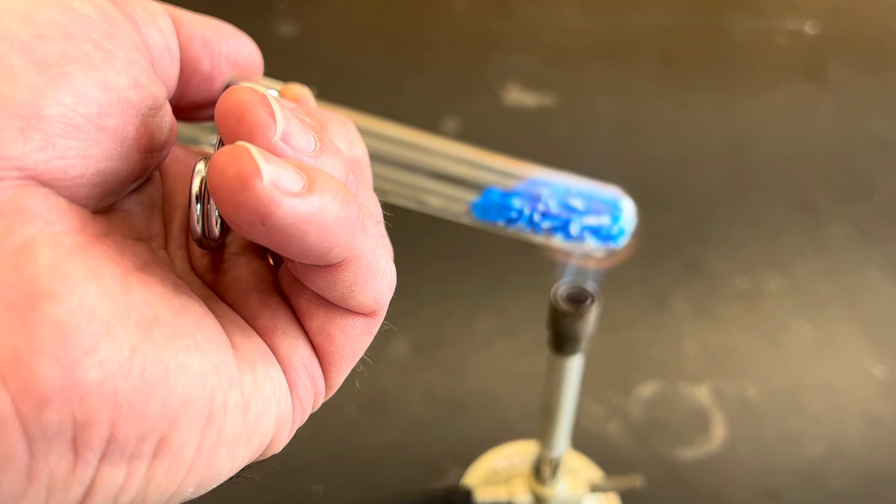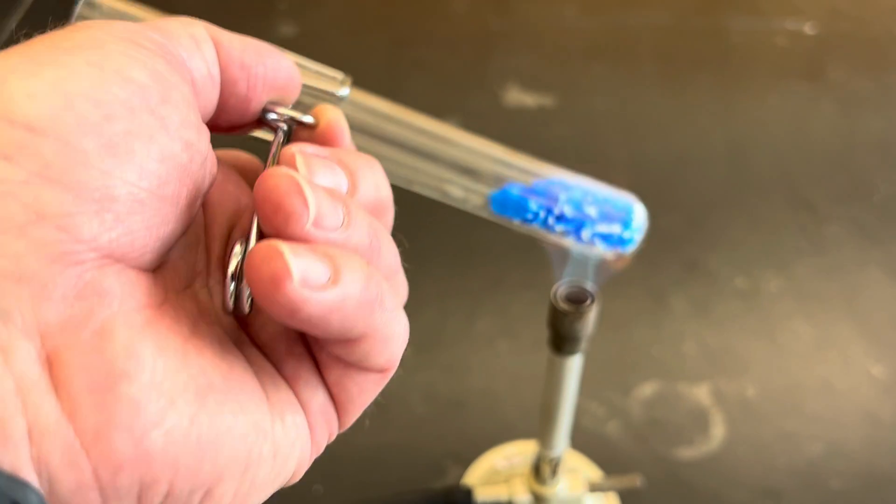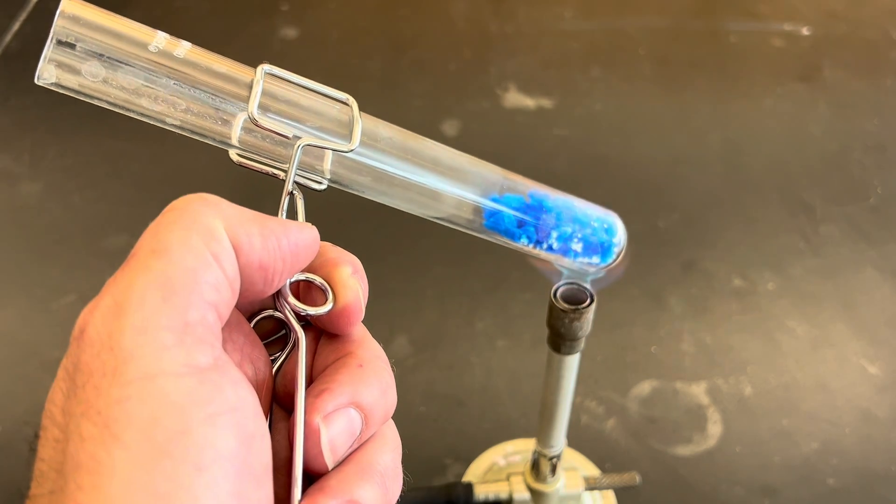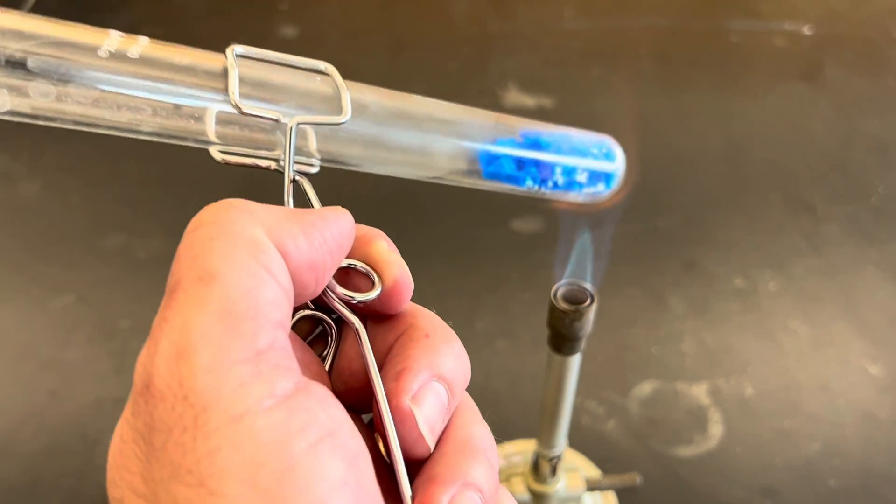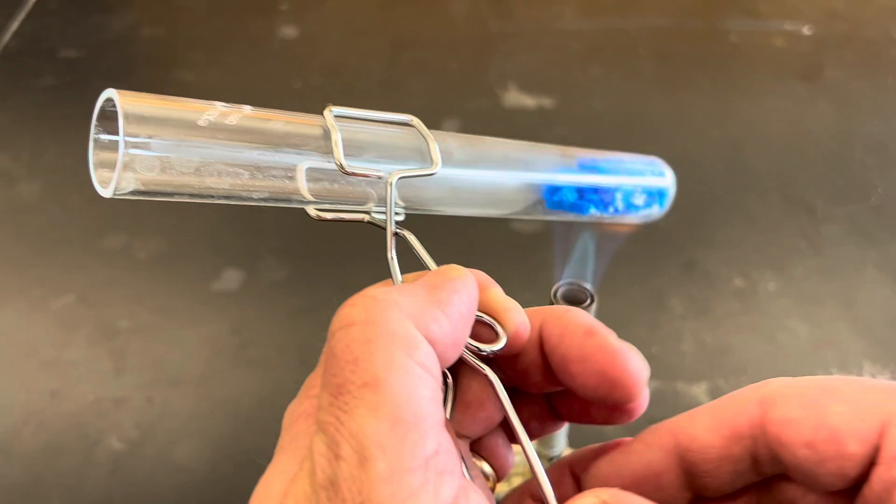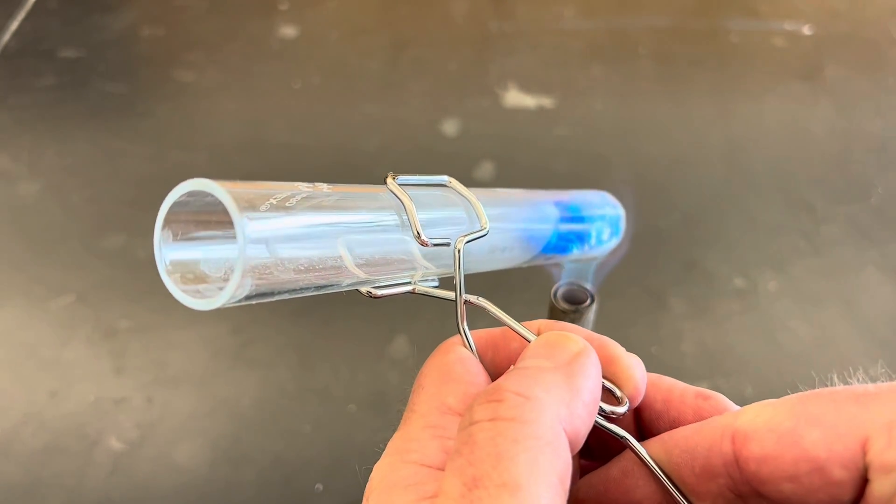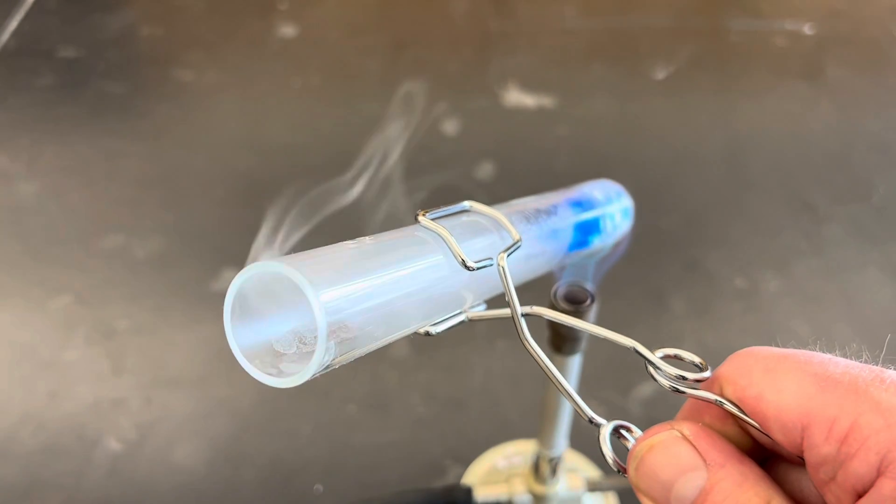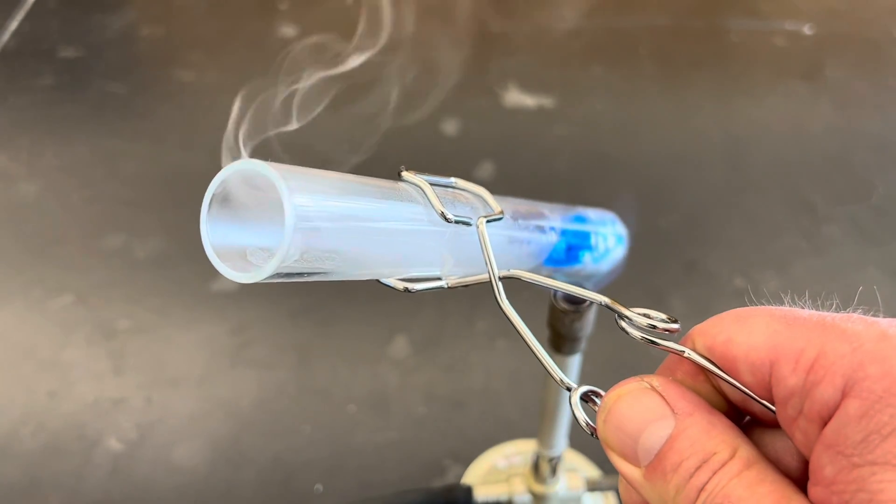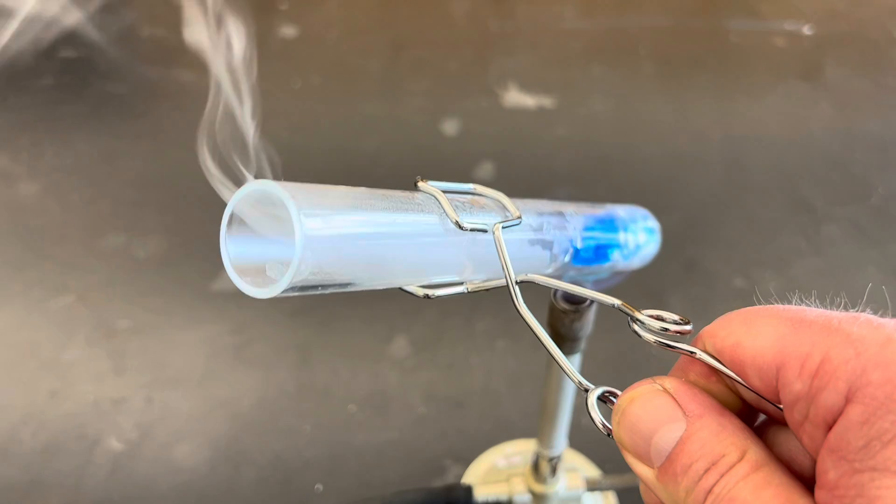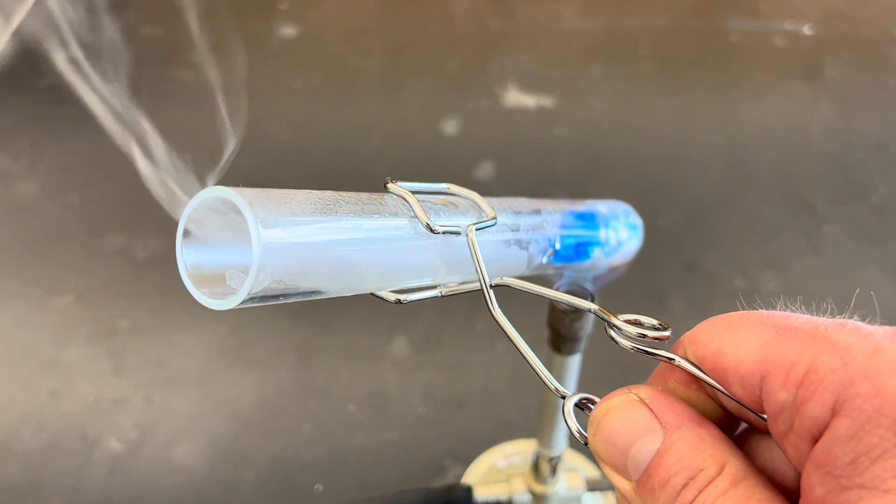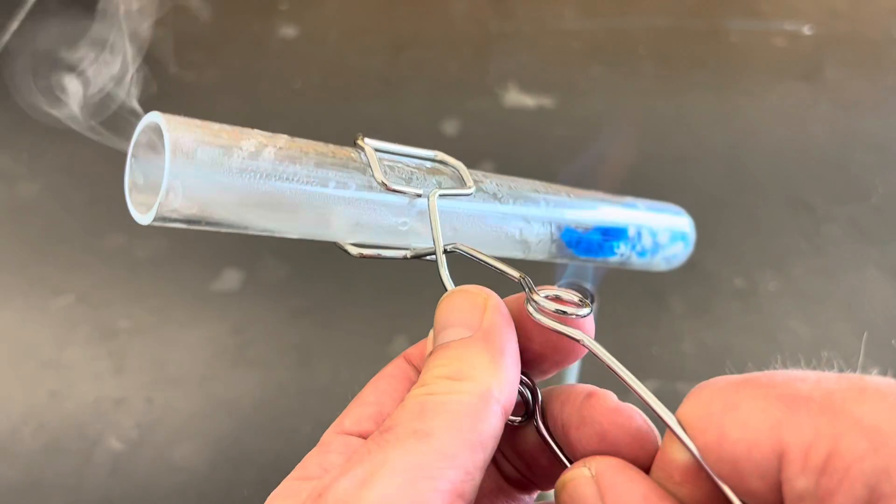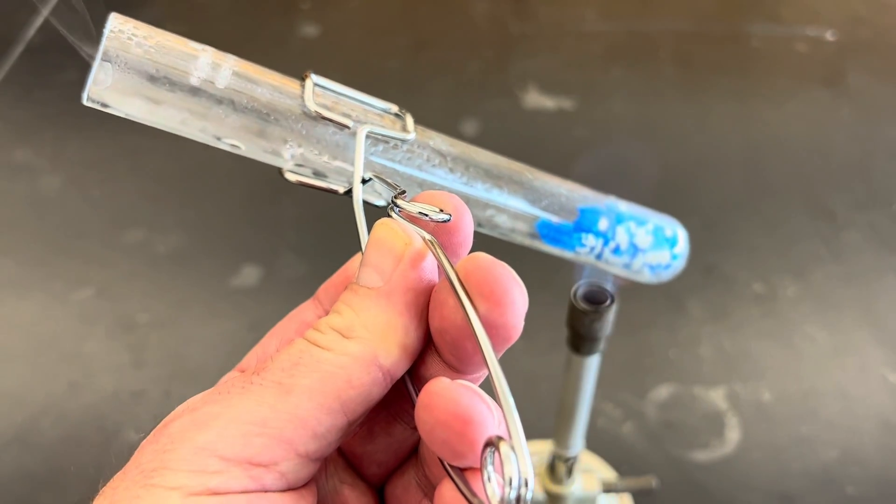You might also hear something happening as well. There's a little hissing noise coming from the end of the test tube, but also notice what else is happening. There is some smoke or steam coming out of the top of the test tube.